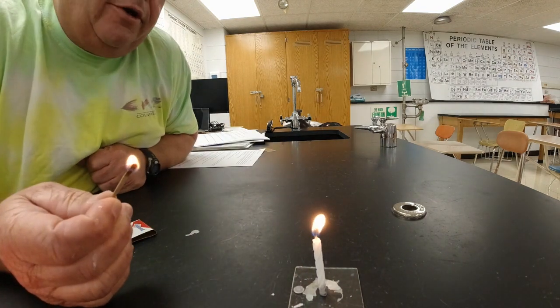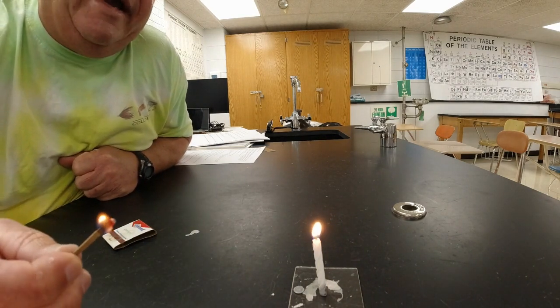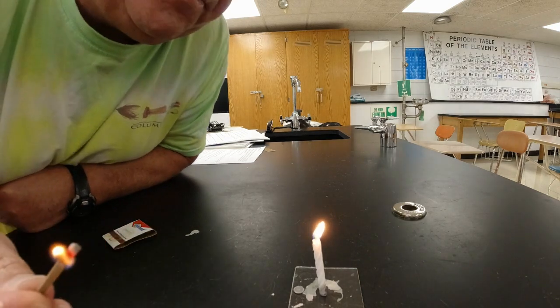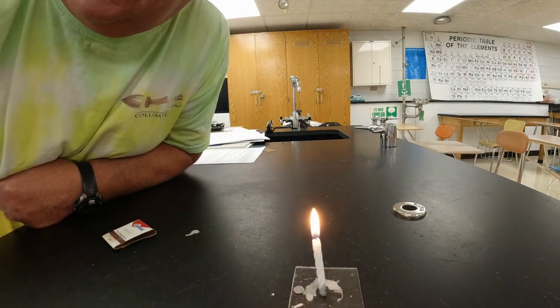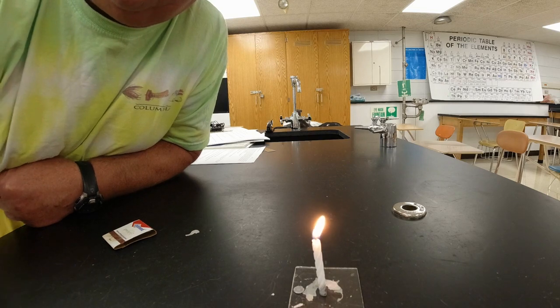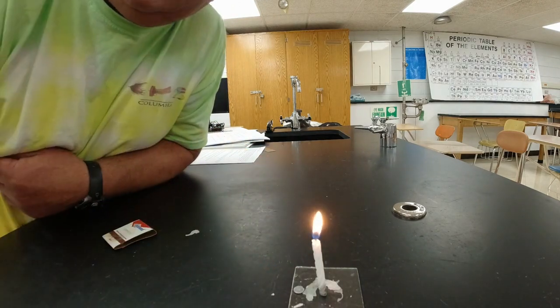All right, so here in part 3, what it says to do is you need to have a lit candle. You're going to blow it out, and you're going to relight the smoke just above it. So we're going to see if we can't get this to work here. And if you look, did you guys see that? The match relit the candle without actually being in the flame. So we're going to try this again. We're going to blow it out. And if you look, it didn't work that time. Didn't get there fast enough.